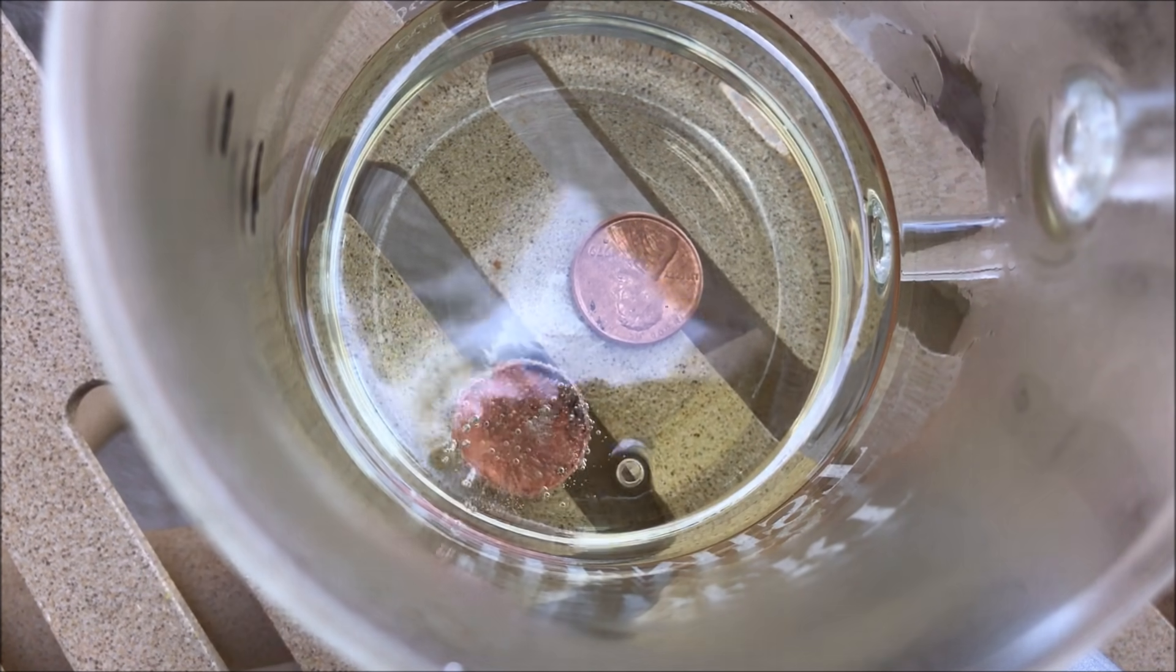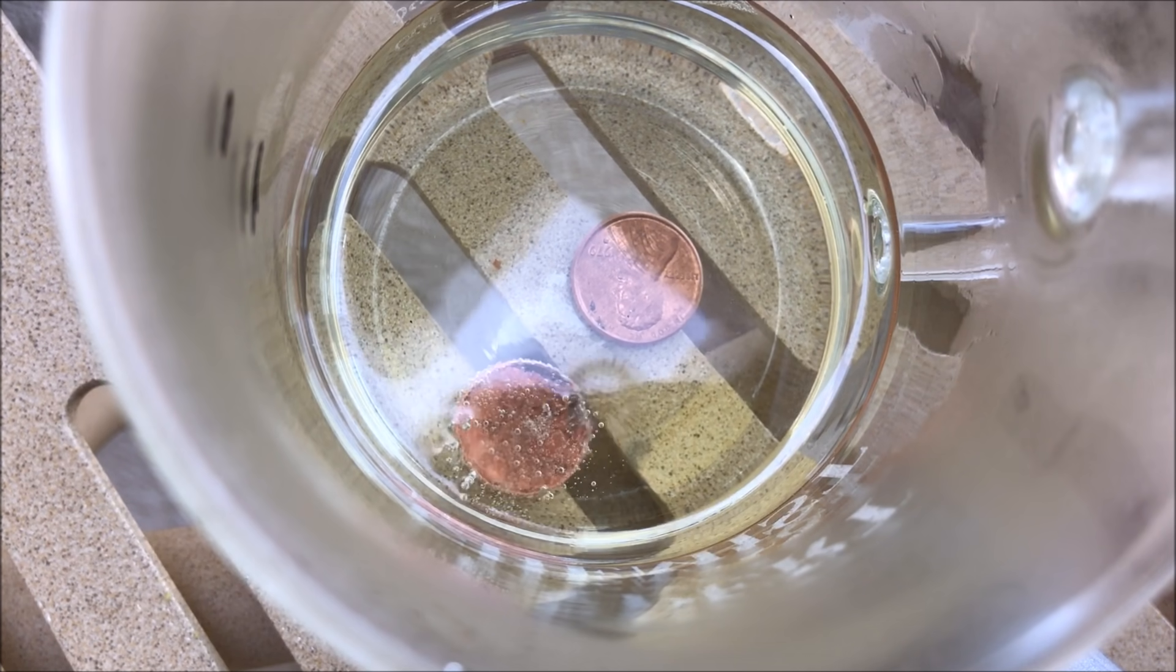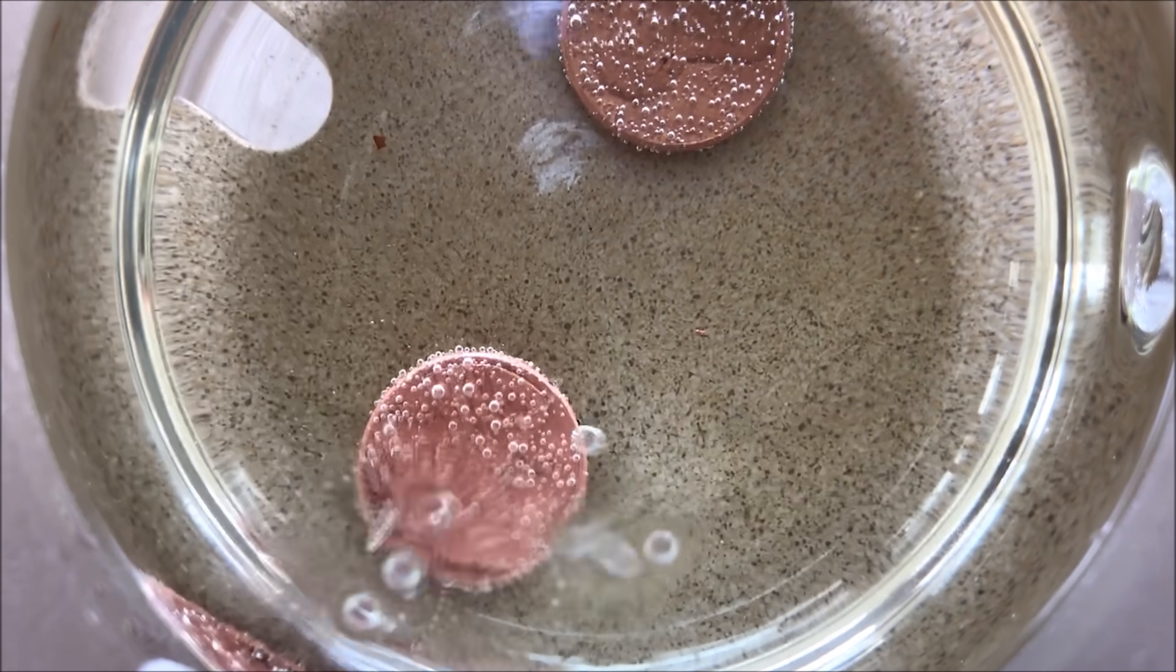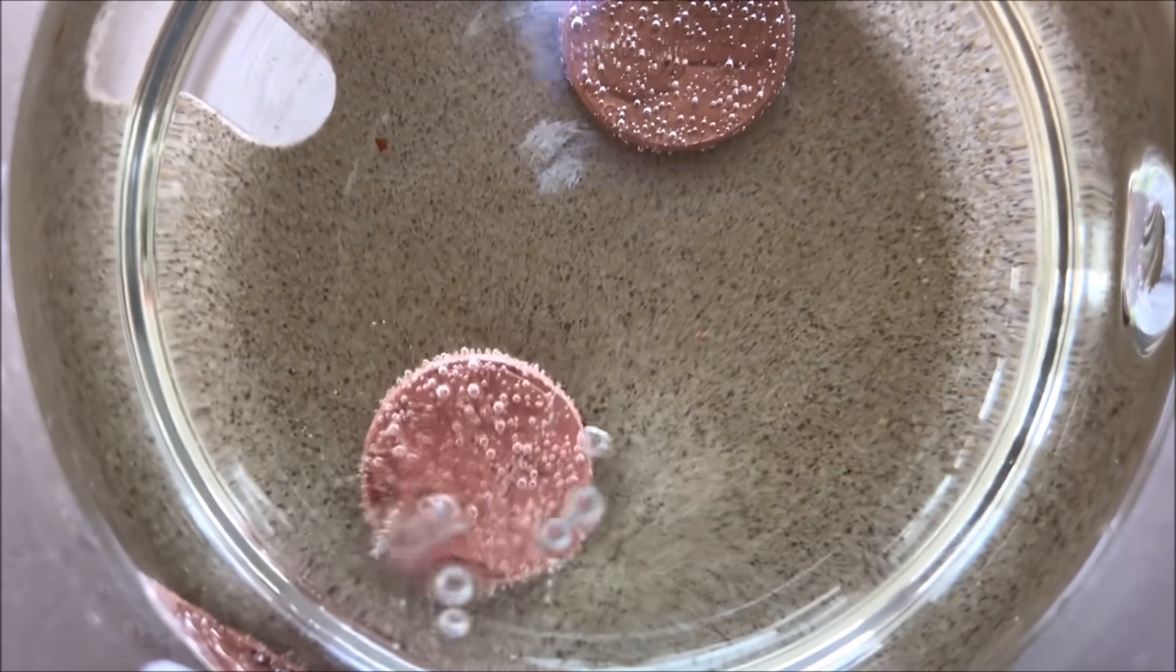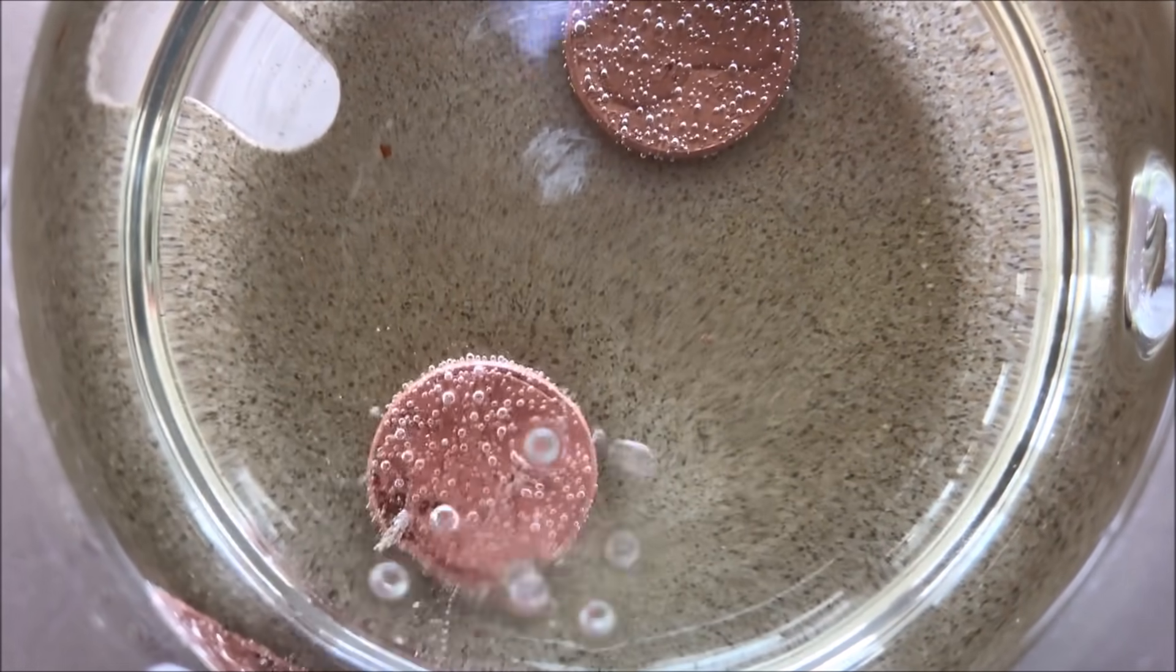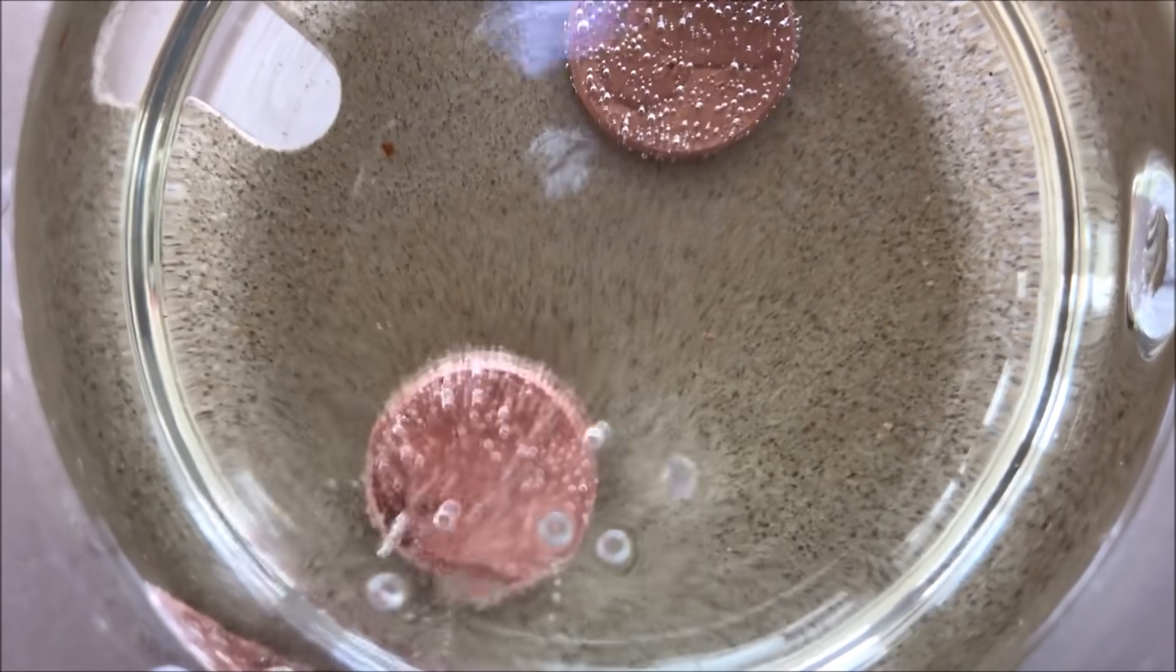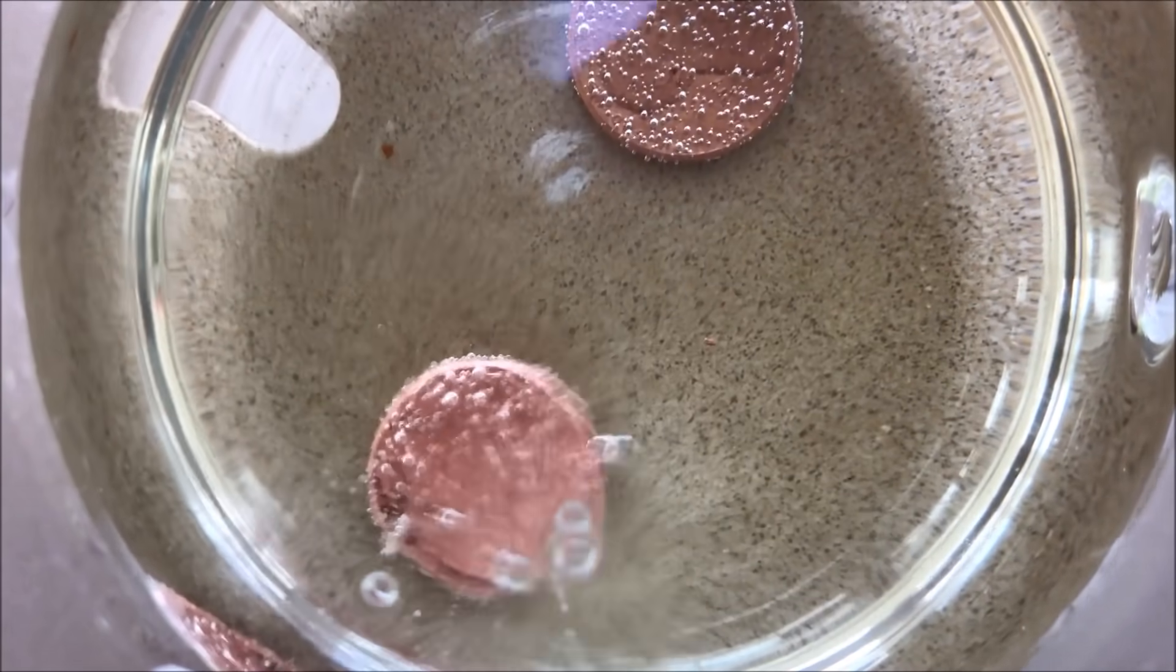So let's see what happens. I'm going to turn this off and we'll be back later. The reaction has been going for quite a few hours and it's going pretty quickly. So we're going to leave it overnight and see what happens.